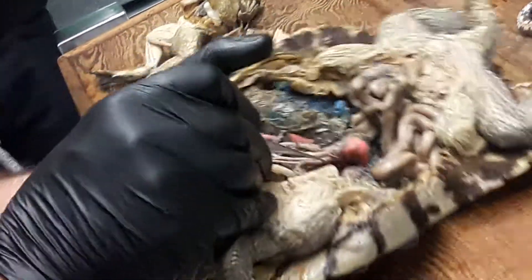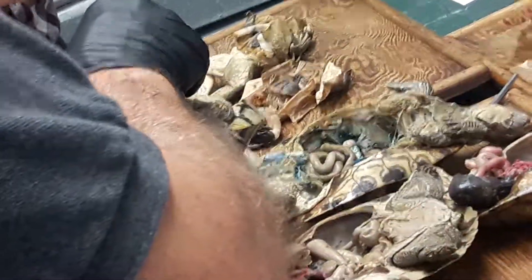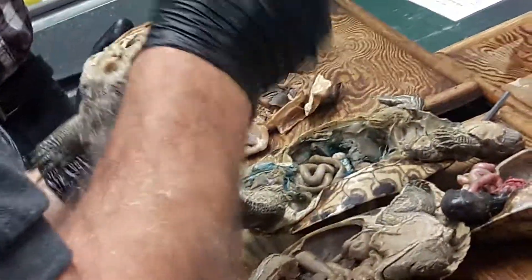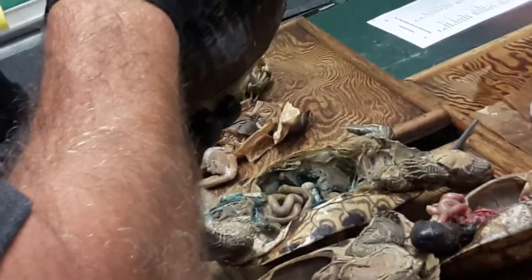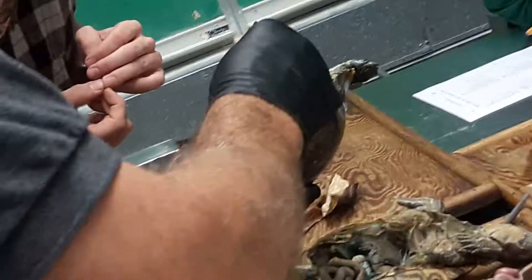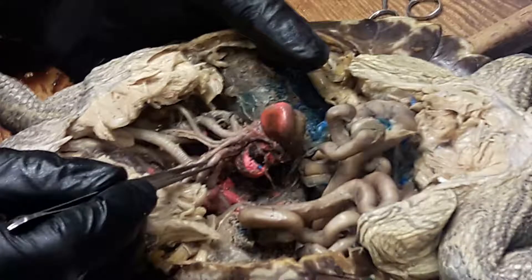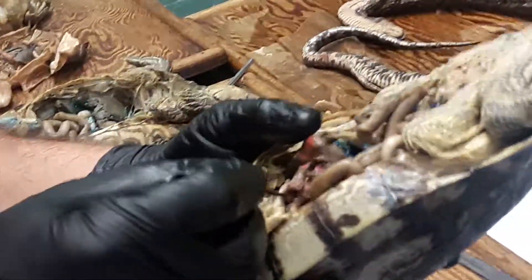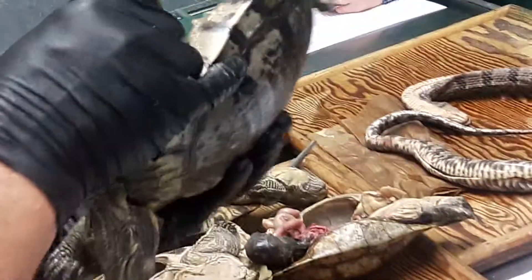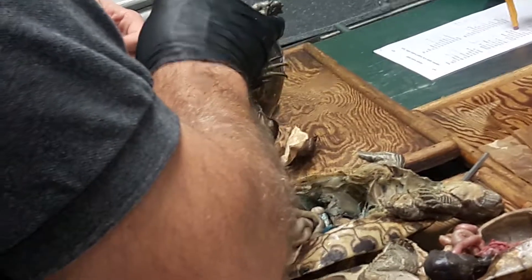So we've got the subclavians and carotids coming off. This chunk that they're coming off of right there is the brachiocephalic artery or trunk. The right systemic is there but it's kind of hiding in the back. That's the right systemic artery coming around here, coming off the backside of all of this.